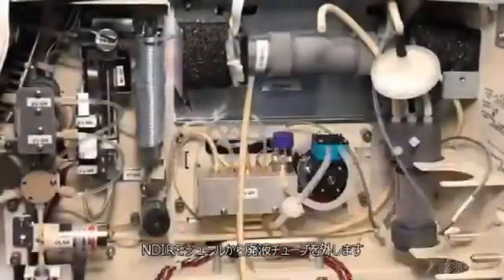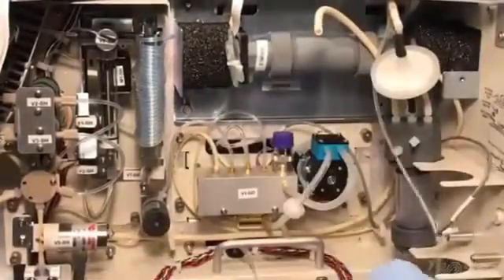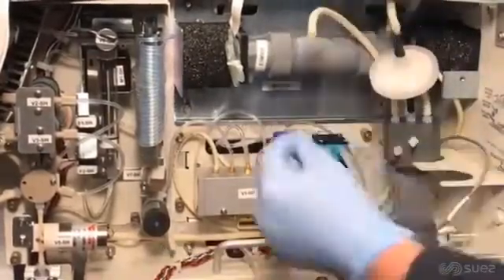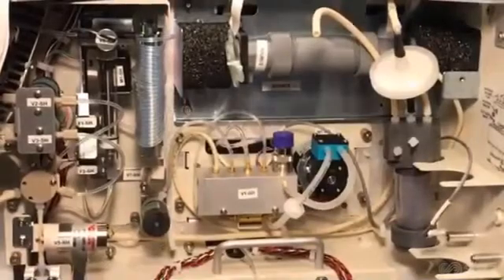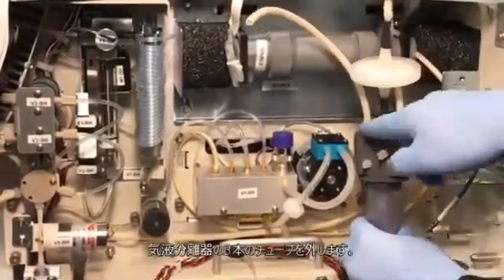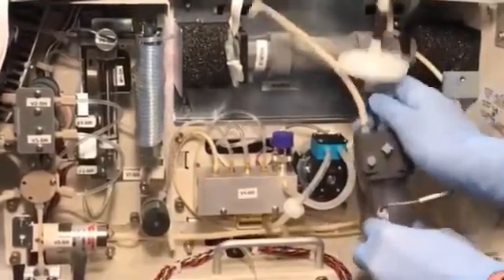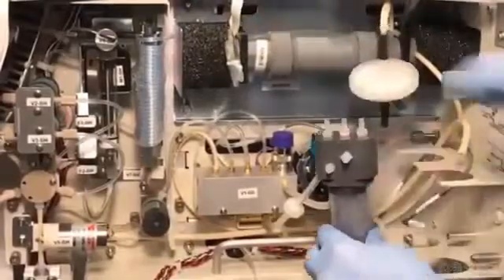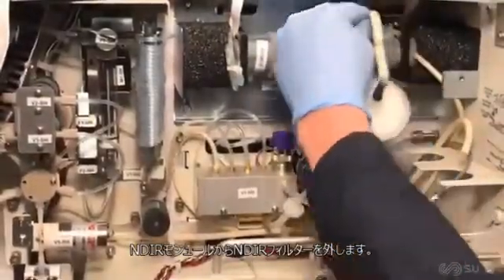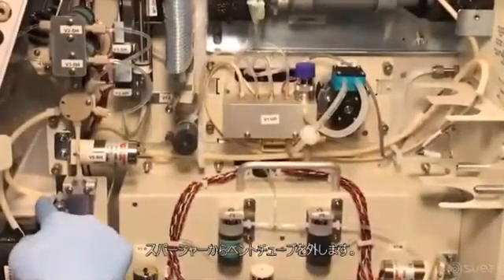Remove the waste tubing from the bottom of the NDIR source end cap. Disconnect the clear tubing extending from V1R to the plastic T between the NDIR filter and the NDIR detector end cap barb. Disconnect the 3 sections of tubing from the top of the gas-liquid separator. Set the gas-liquid separator aside for reinstallation. Disconnect and remove the section of tubing extending from the top of the NDIR detector end cap. Disconnect the vent tubing from the sparger and remove.